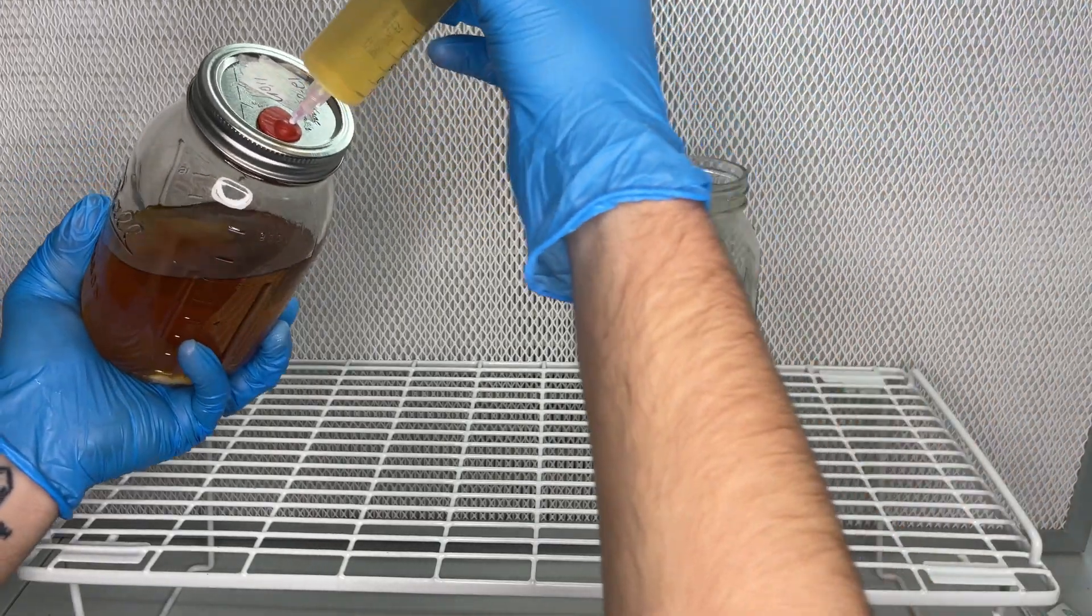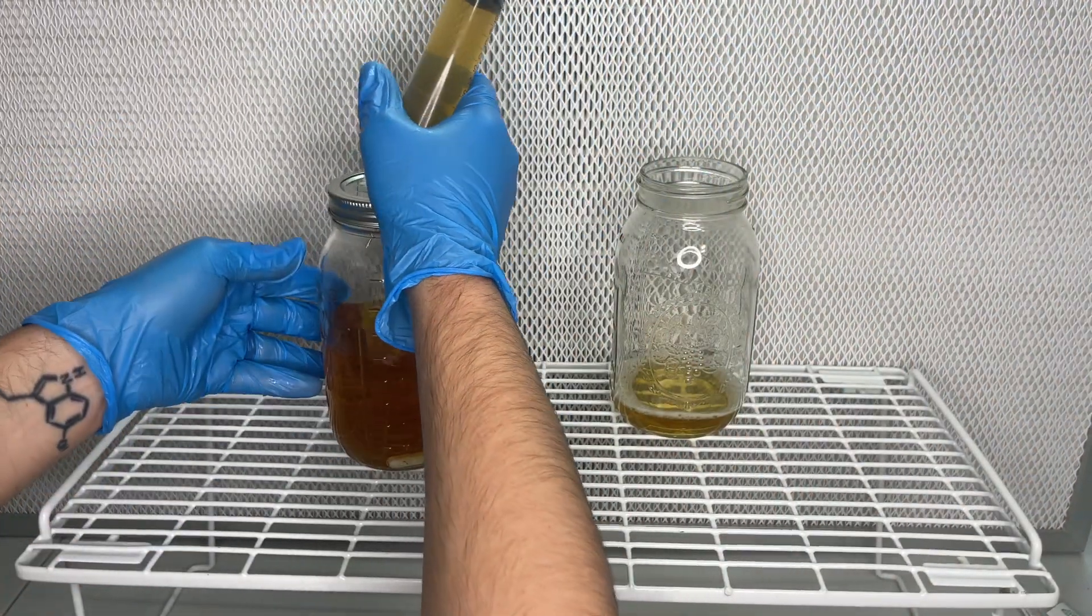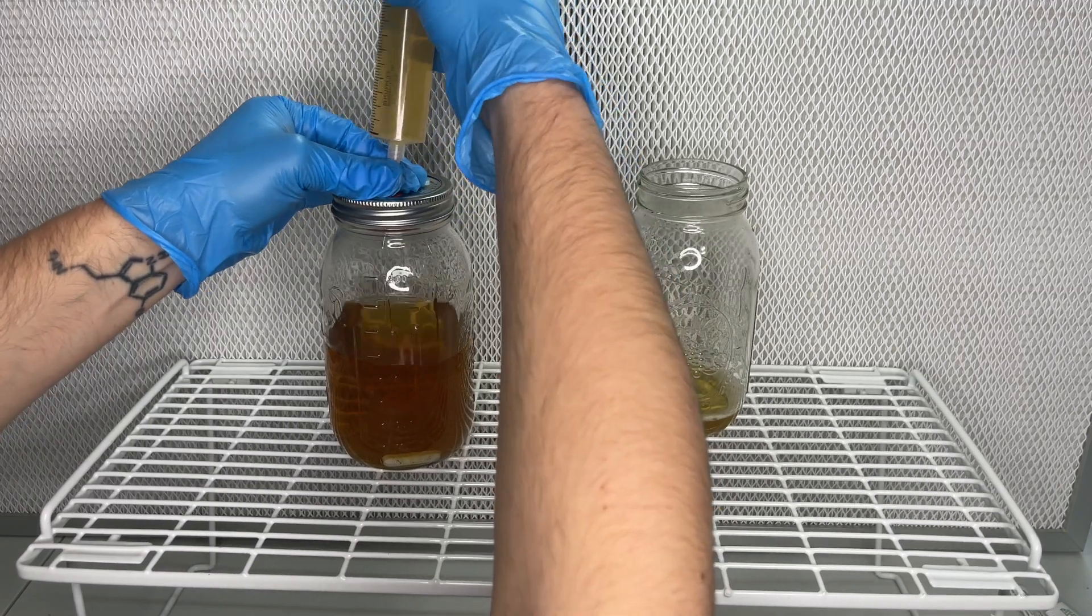This part definitely had me wondering if there's some type of machine that can help me pull back the plunger automatically.